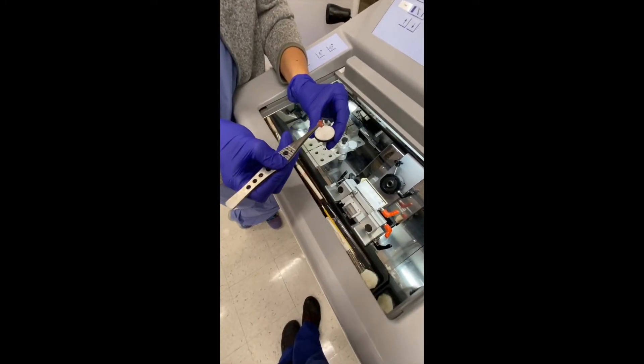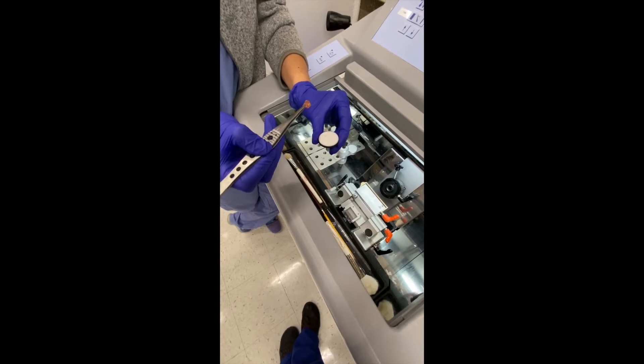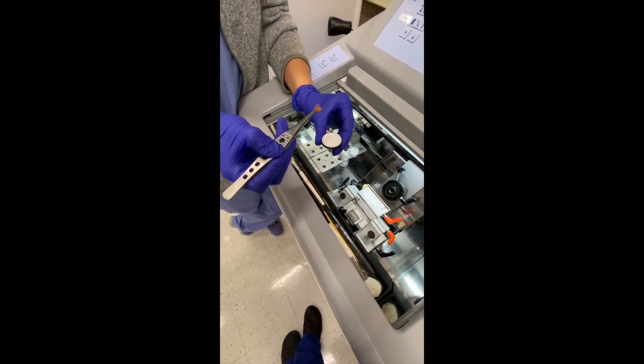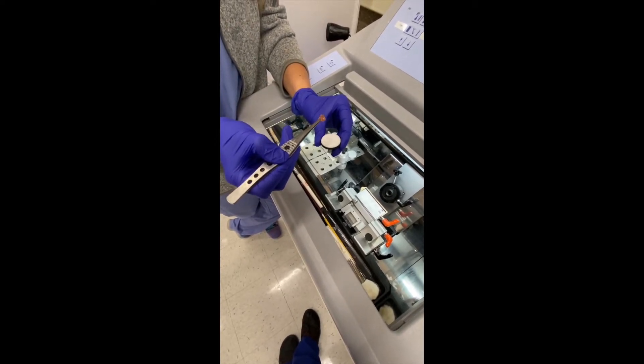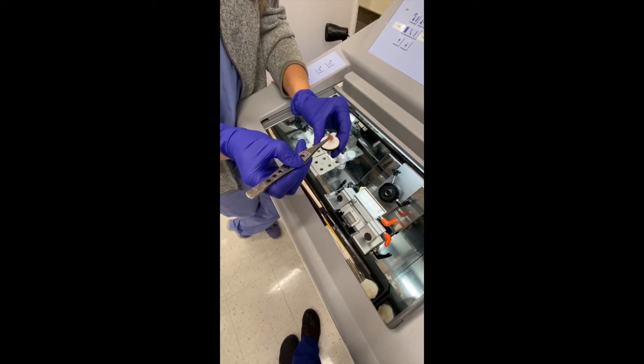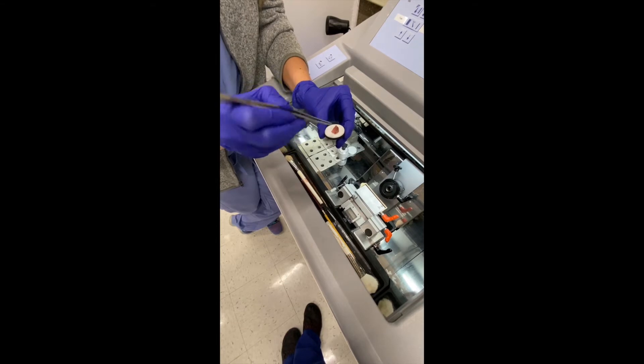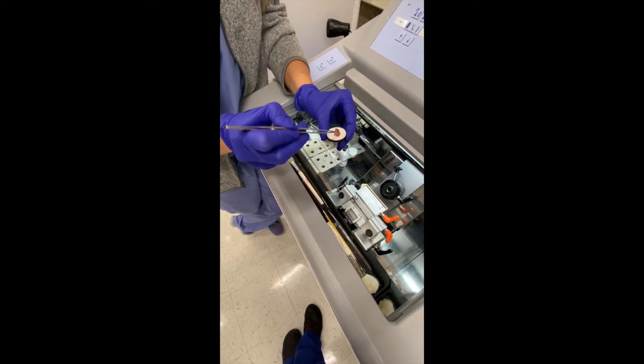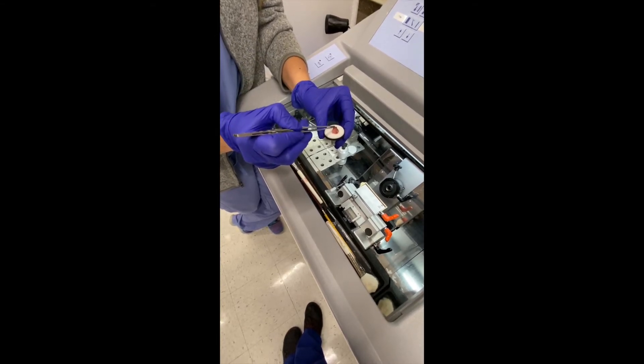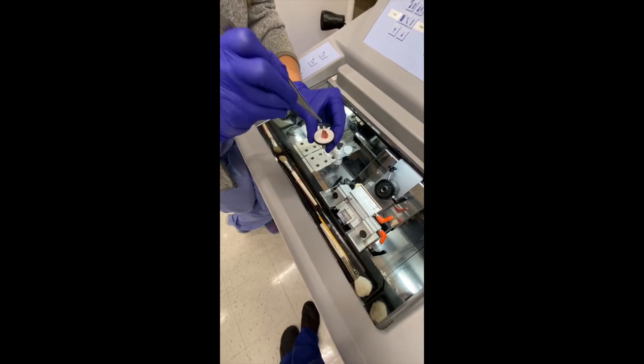When getting ready to embed tissue using the chuck, keep in mind that it's opposite what you used when you were doing embedding for histology. The surface area facing up is what's going to be cut here, so whatever you want to be demonstrated on the slide needs to face you.